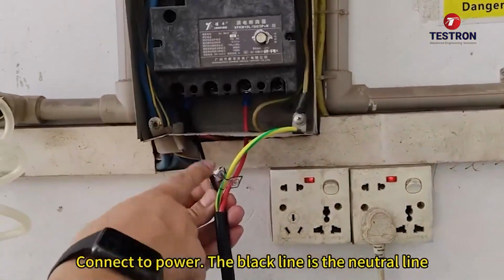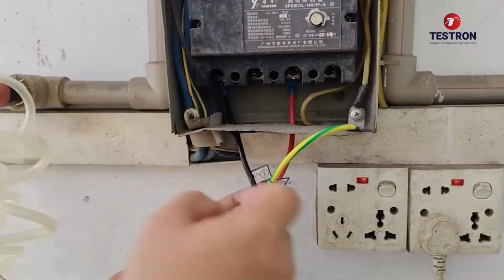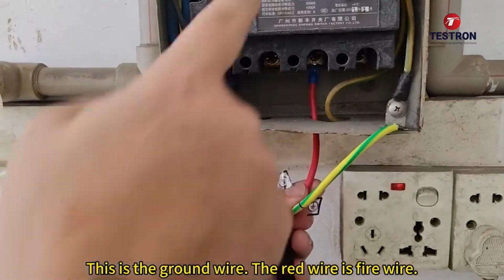Connect to power. The black line is the neutral line. This is the ground wire. The red wire is the fire wire.